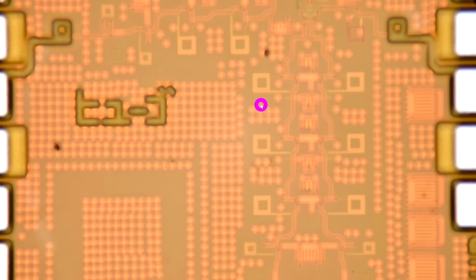And ultimately everything's out of focus. So with an appropriate number of images, I could do focus stacking, and I could bring them all together and create an image that has a very, very deep depth of field, even though the lens itself doesn't support it. So we can try that.